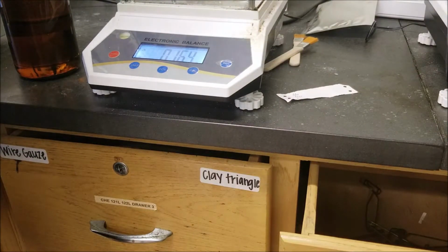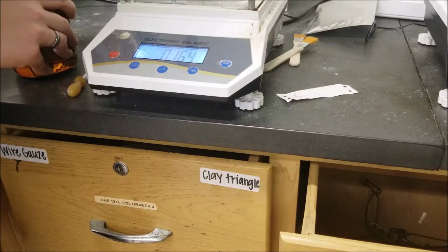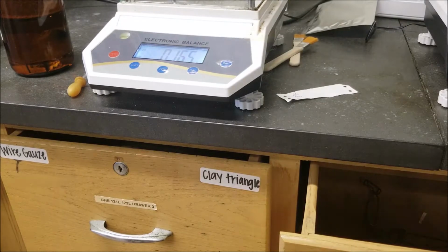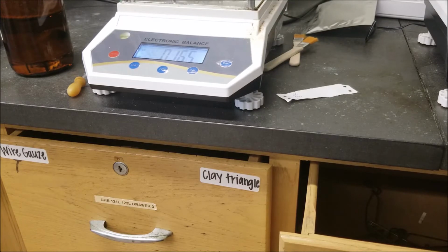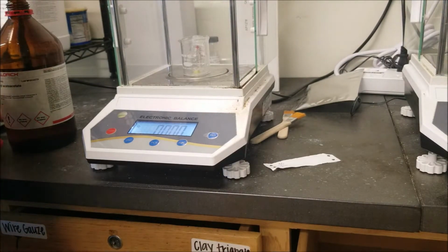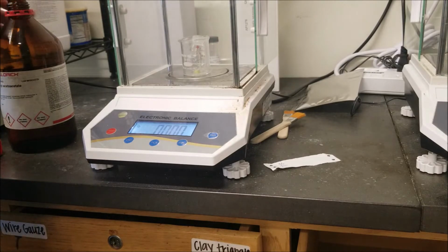So, I'm not sure if you can read that, but the mass of trans-cinnamaldehyde is 0.165. Now, I was shooting for 0.152 to get it on similar molar quantities to my trans chalcone. Now that this is zeroed out again, I'm going to try to add my 0.15 grams of ethyl acetoacetate.